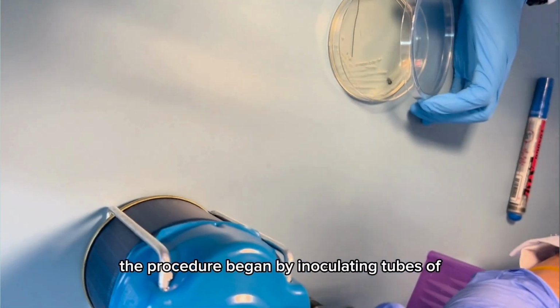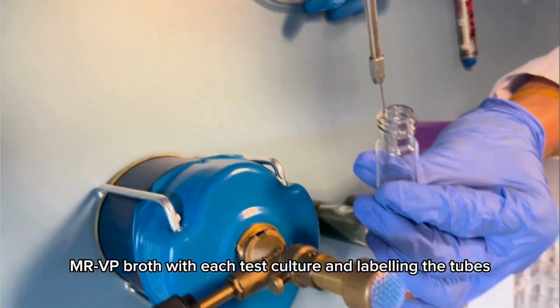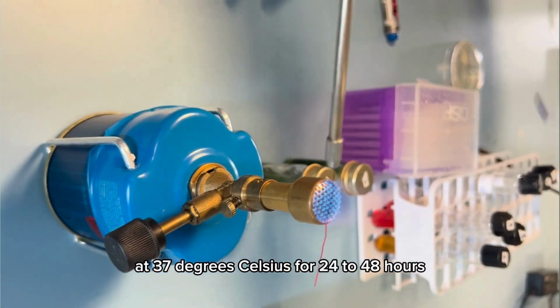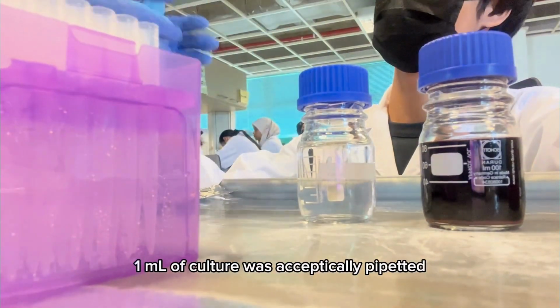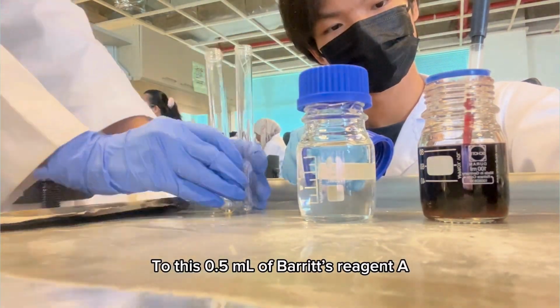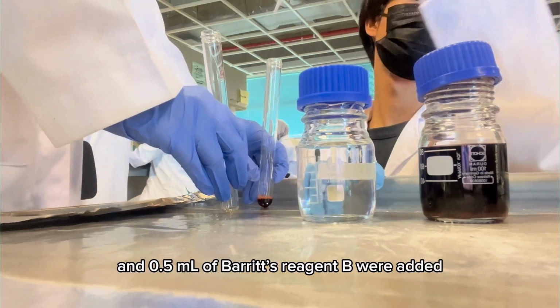The procedure began by inoculating tubes of MRVP broth with each test culture and labeling the tubes. The inoculated tubes were then incubated at 37 degrees Celsius for 24 to 48 hours. After incubation, 1 ml of culture was aseptically pipetted into a clean test tube. To this, 0.5 ml of Barritt's reagent A and 0.5 ml of Barritt's reagent B were added.